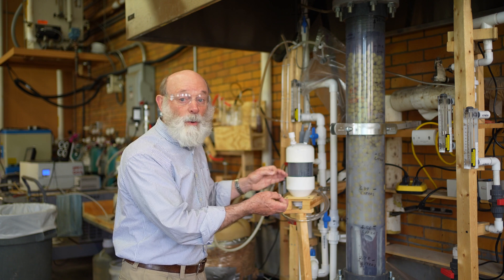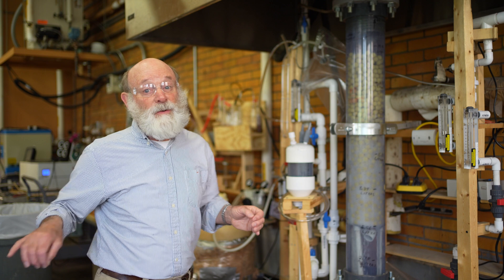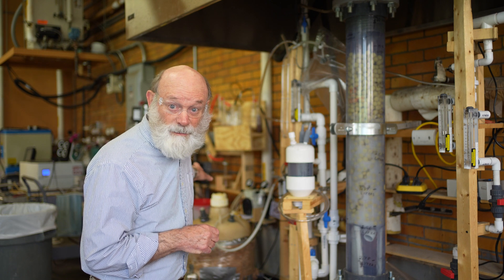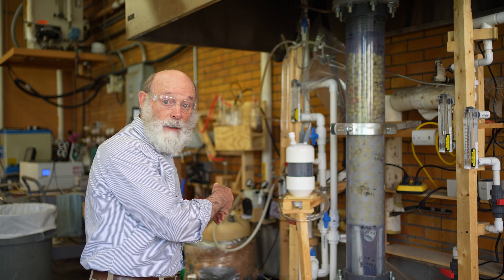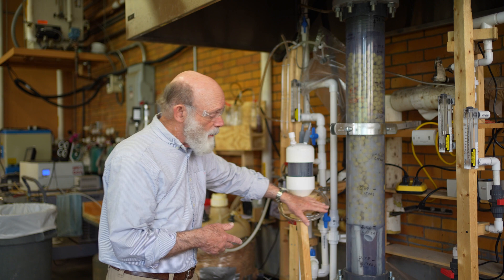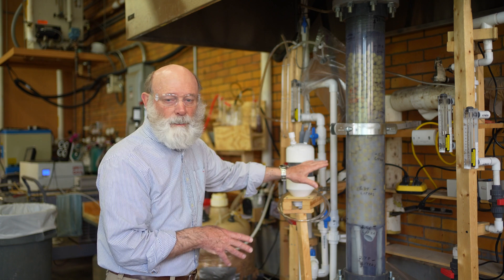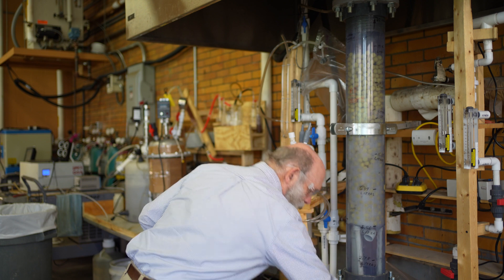But this is the reverse of that, where we're taking syngas. We're actually making syngas in this experiment using some compressed hydrogen from a cylinder and some compressed carbon monoxide from a compressed gas cylinder, mixing the two gases, and then feeding it to the anaerobic bacteria that are circulating and contacting each other in this column.